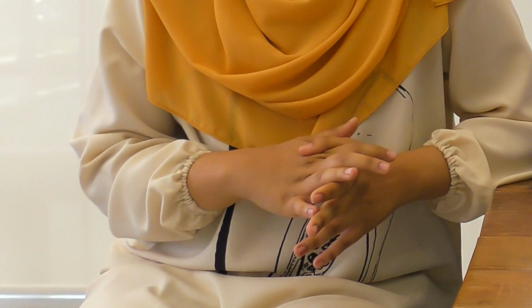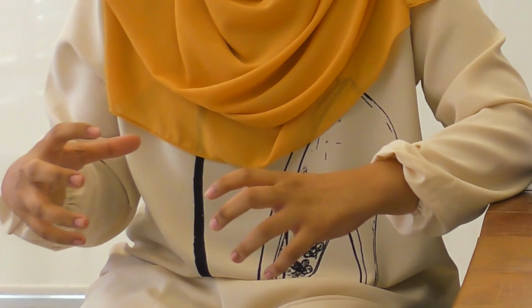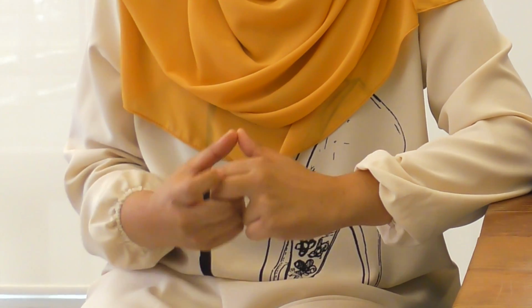This project is aiming for the development of a low-cost olfactometer that can be used for smell experiments in the lab, including fMRI experiments. One example of this experiment is that the subject sits in a room, and the subject's hand is immersed in ice water for a maximum of 2 minutes. Different odors are presented to verify that the assessment of pain is well correlated with the pleasantness of the odor.